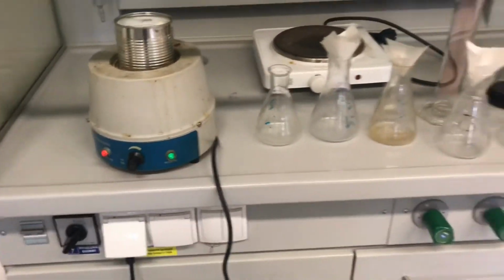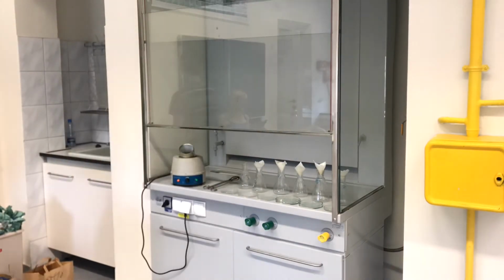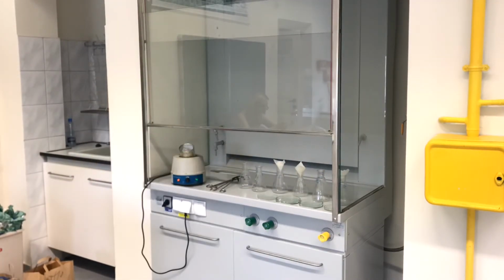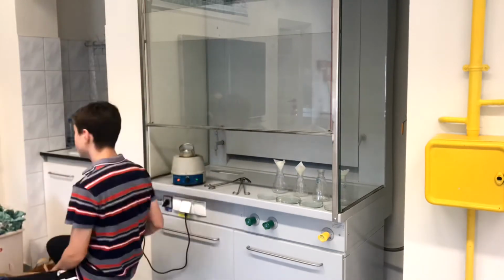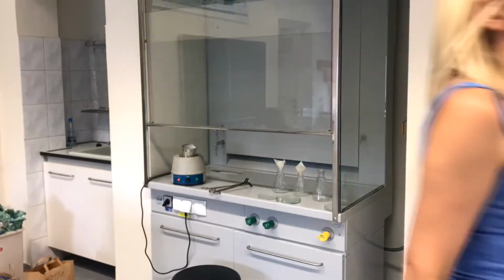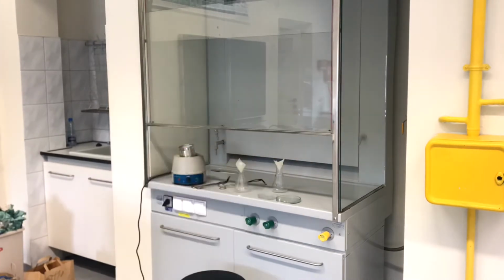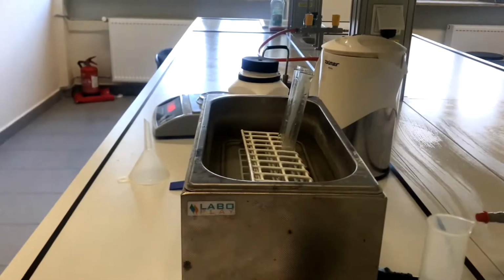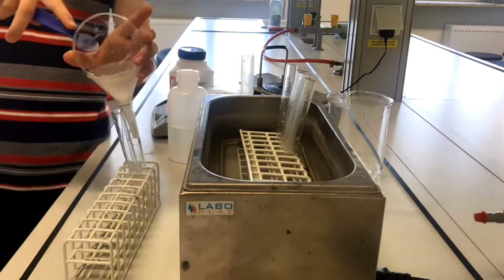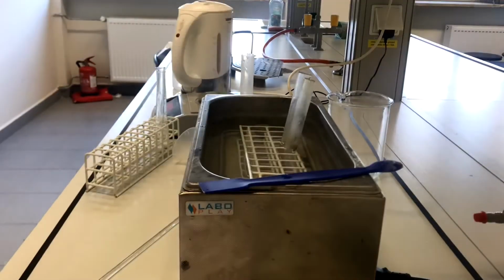Because I was running low on time and my salts of the day were not yet dried, I decided to speed up the drying process with yet another heater. I also had to redo some of the experiments that had failed, and also clean up a bit after myself, as I had by that time made quite a huge mess.